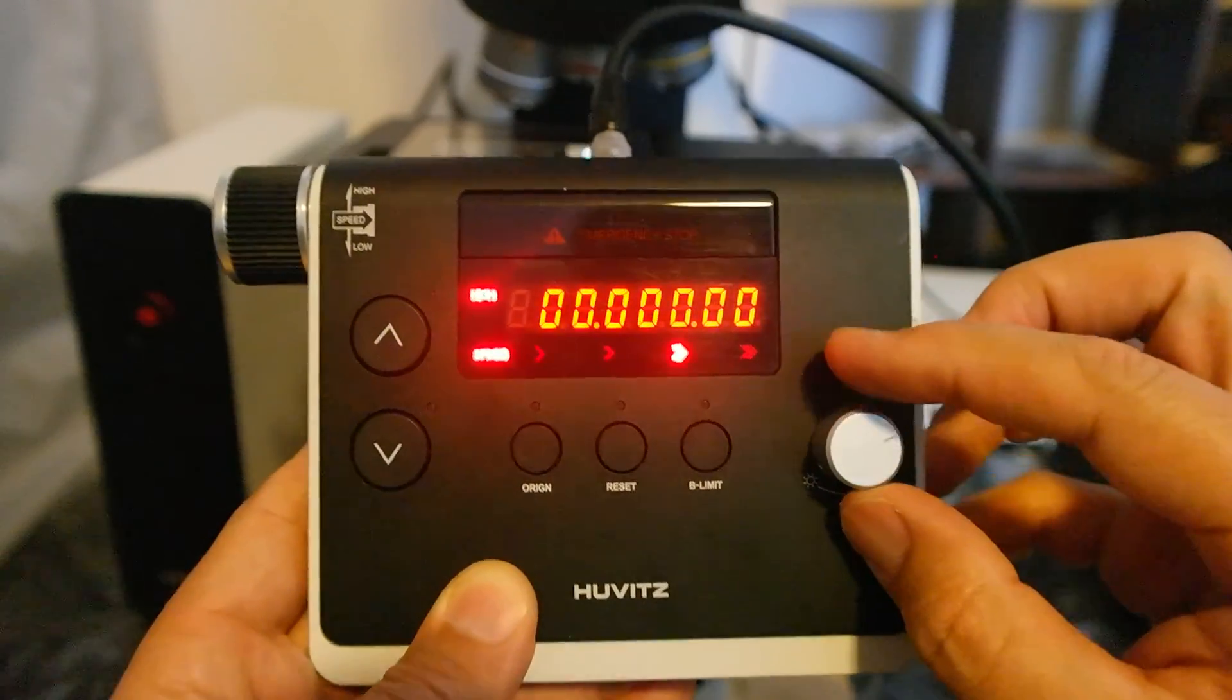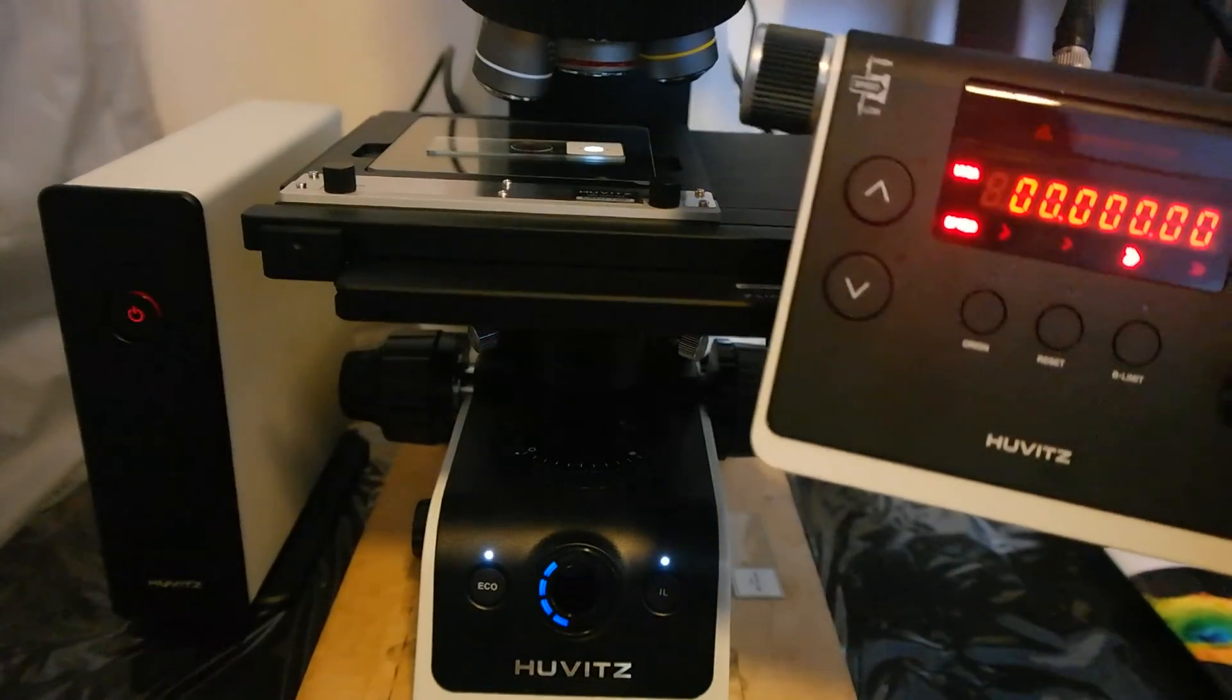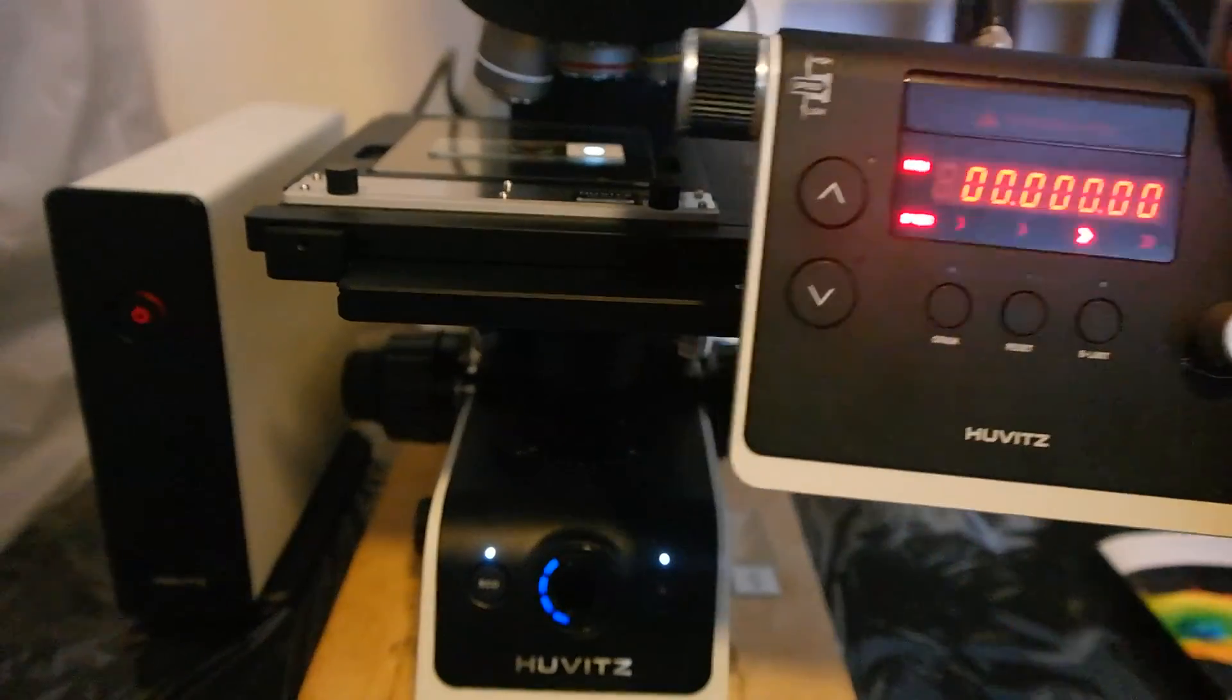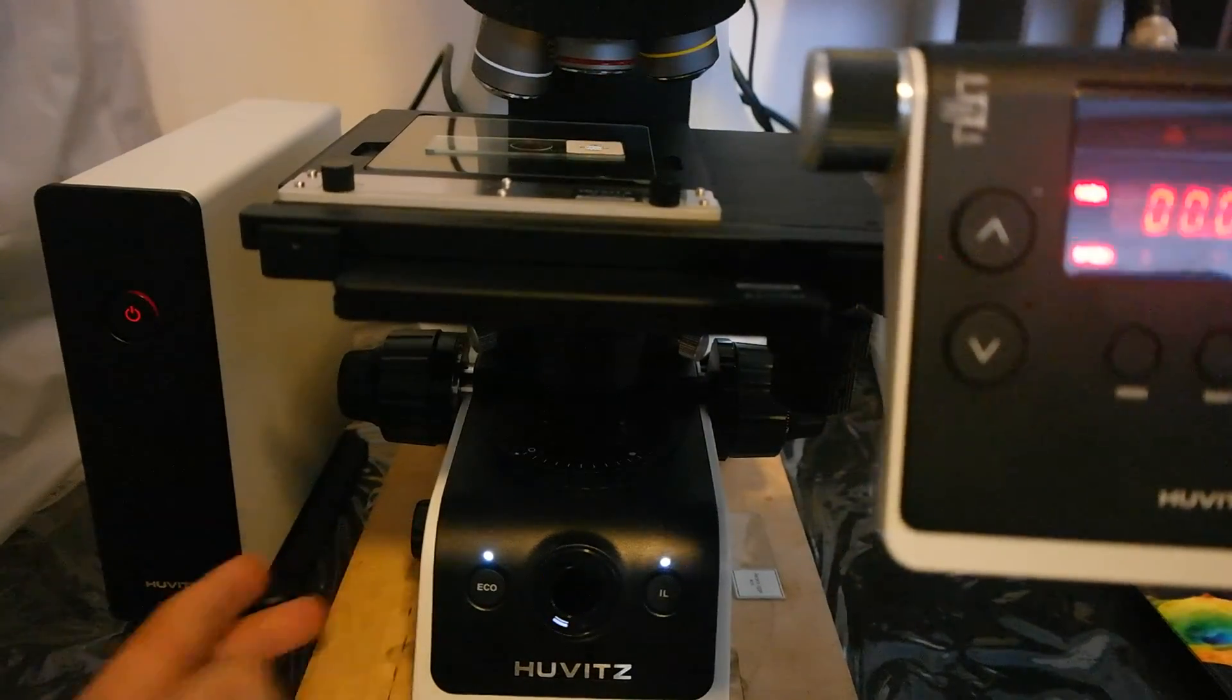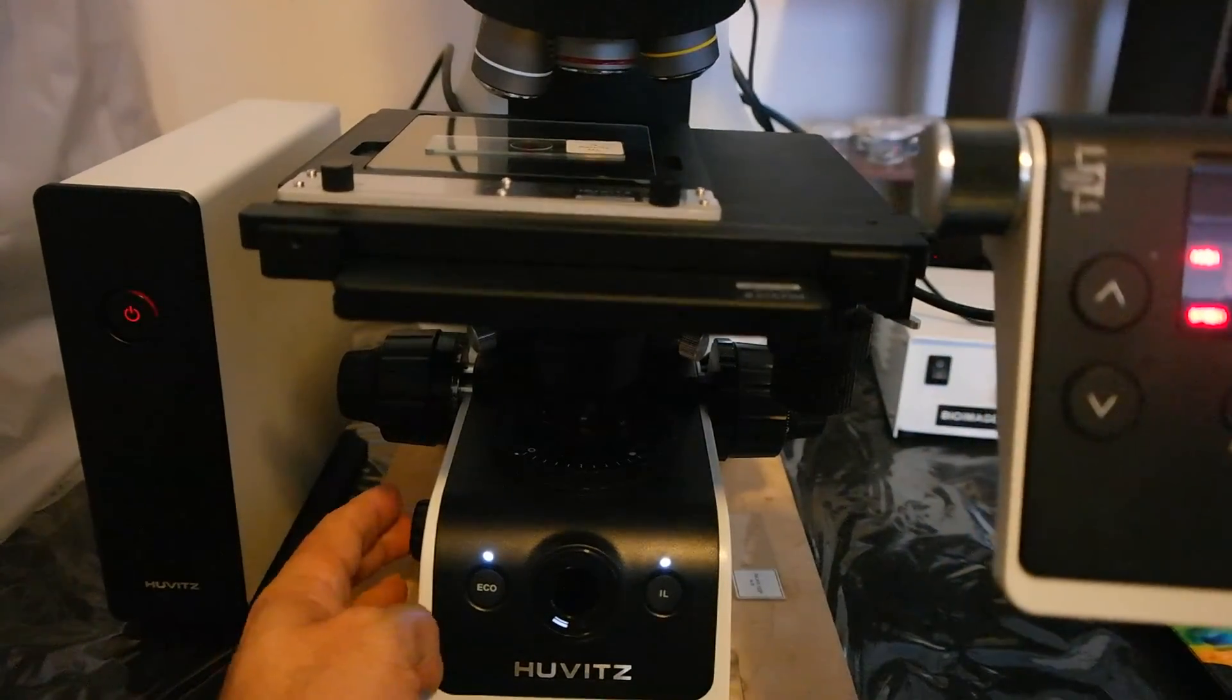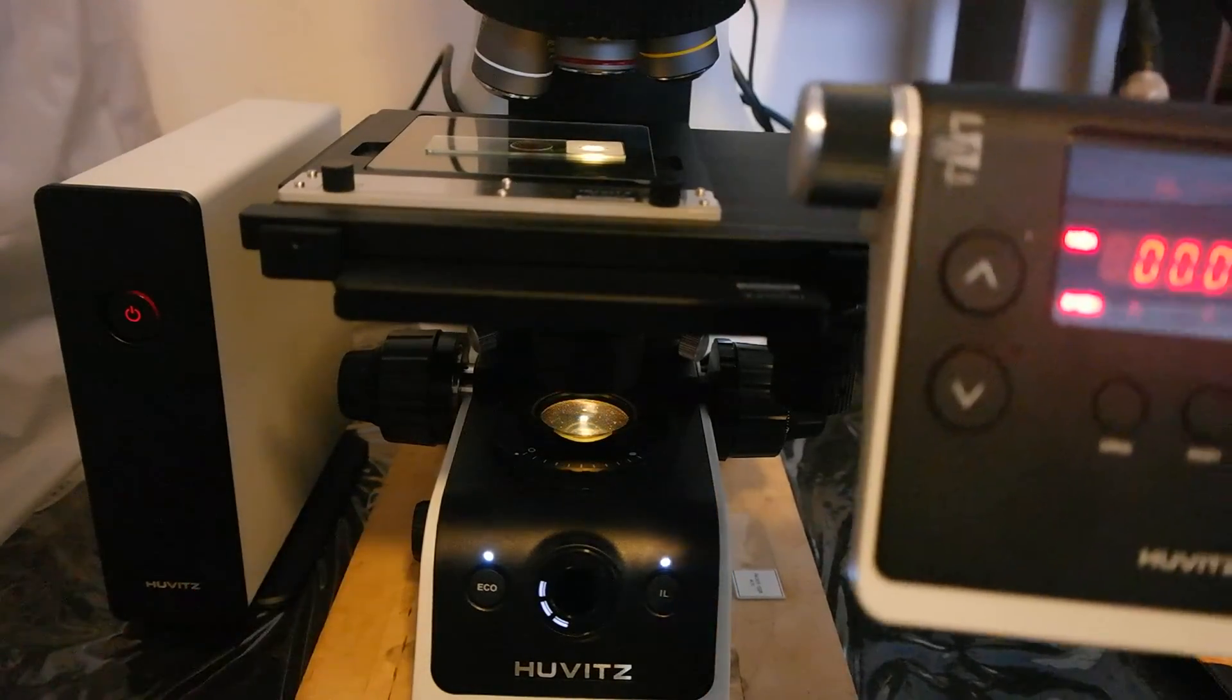And here is also another cool feature. So while you see the microscope I'm using this. Let's move to transmitted light. I'm going to give you a little bit light over here. You can see it.